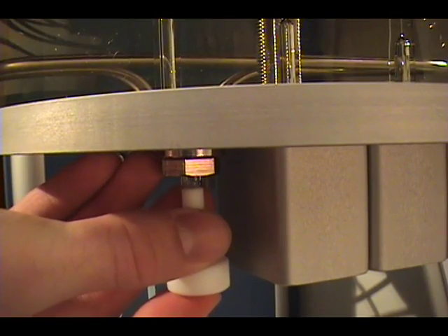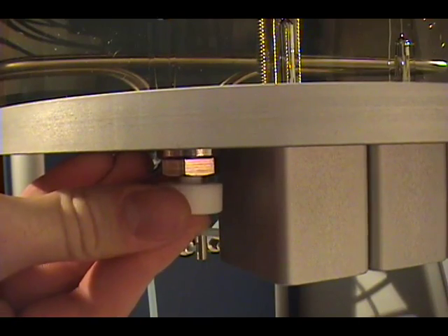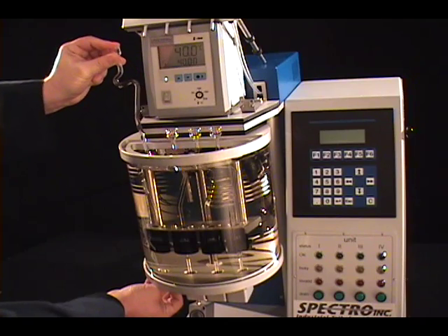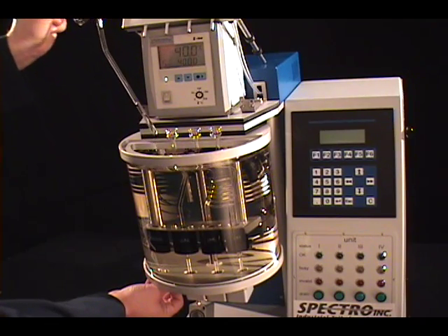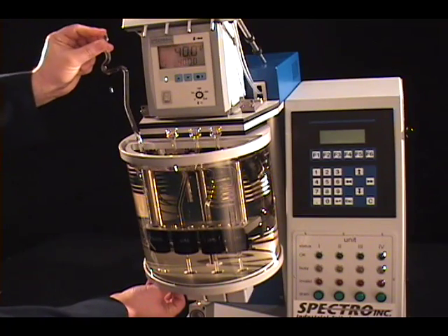Using the special stopper, gently push upwards on the bottom of the tube while supporting the top of the tube with your other hand. In one continuous motion, the tube is pulled out and the stopper replaces it, sealing the bath. To insert a tube, simply reverse the process.